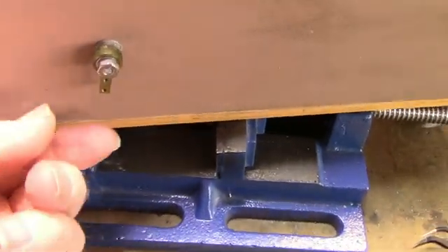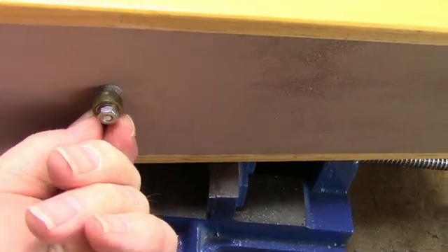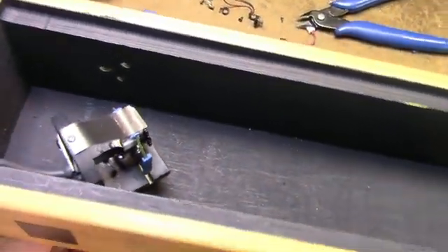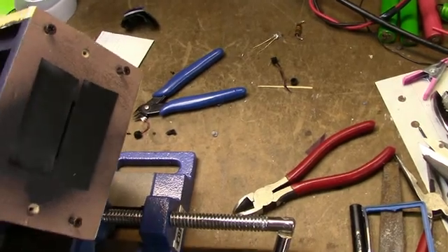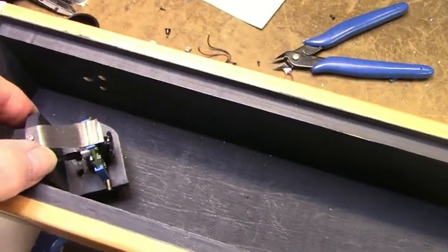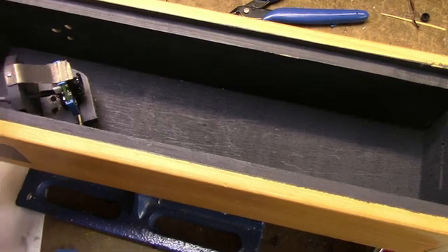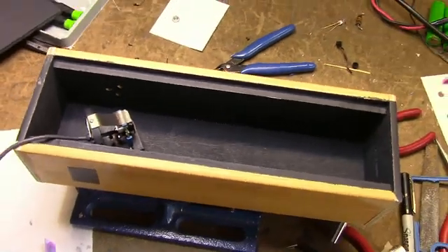On the bottom, there's a small crank here where I can adjust the angle of the turntable. And here you can see as I adjust that lever, I can adjust the angle. Of course, the slit in the front, it's horizontal. And then I can adjust the table here to approximately 30 degrees off of this plane here. So that is a detail of how the inside of this was constructed.